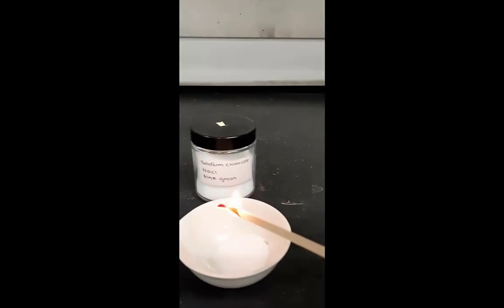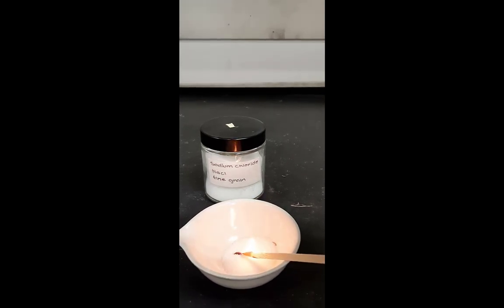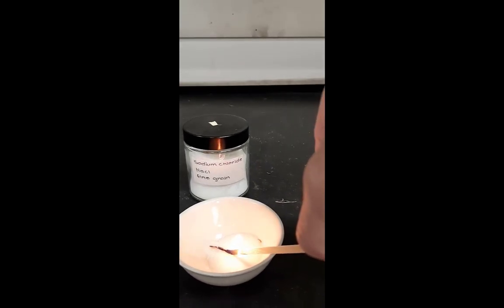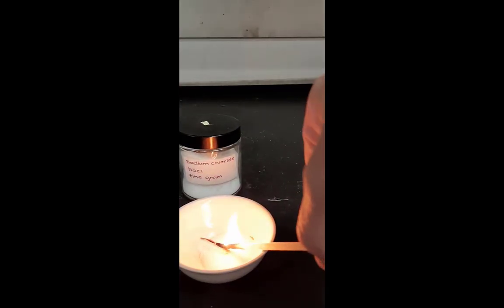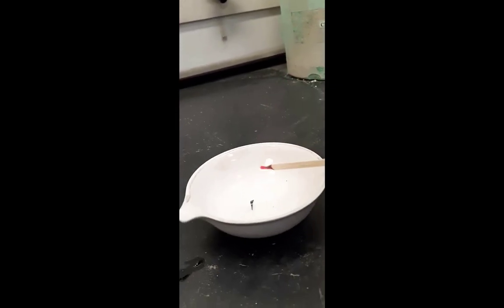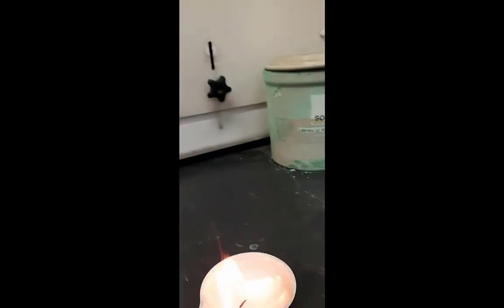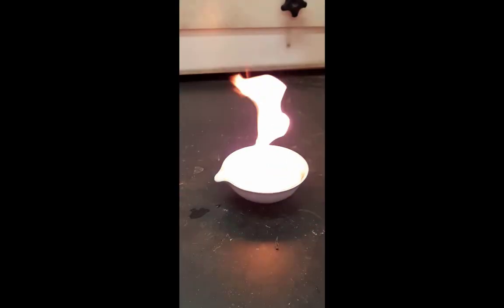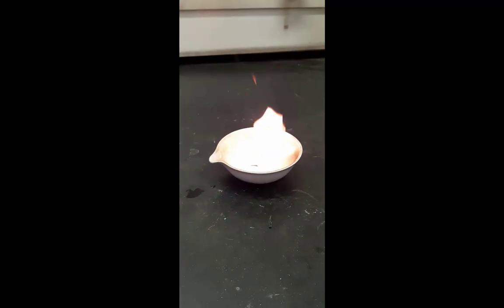Here I have taken a wooden splint and am trying to ignite solid sodium chloride or table salt. You'll notice that the wood is more than happy to burn but the sodium chloride does not burn. Here I have taken liquid cyclohexane which is clearly labeled as flammable, and I'm going to attempt to ignite it in the evaporating dish. And you'll see it's only more than happy to ignite. I go ahead and I move the rest of that away. Don't worry, no buildings were destroyed and no one was injured in this process.